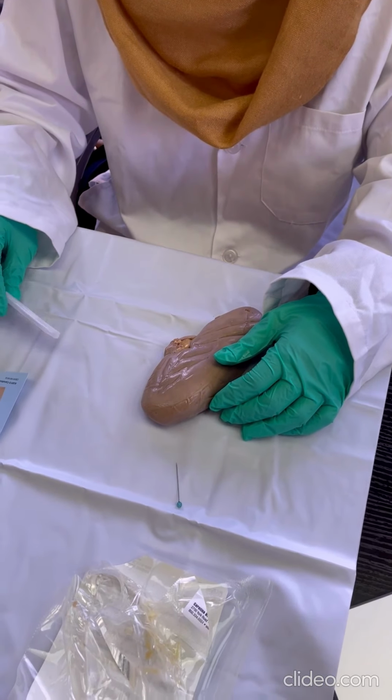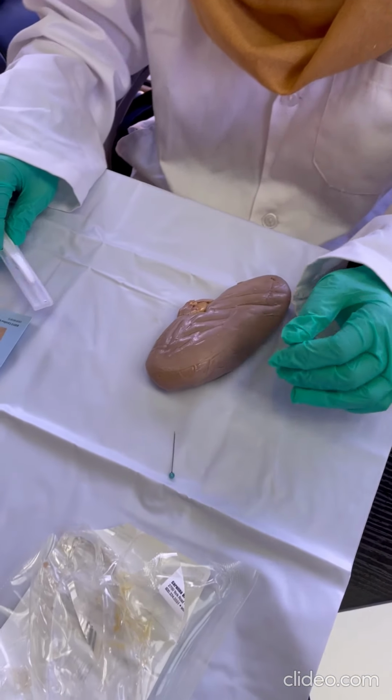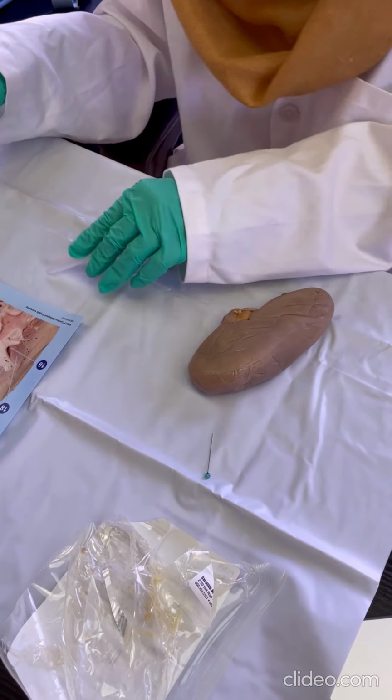Hello, in this video we will be dissecting a sheep's kidney. So let's get at it.